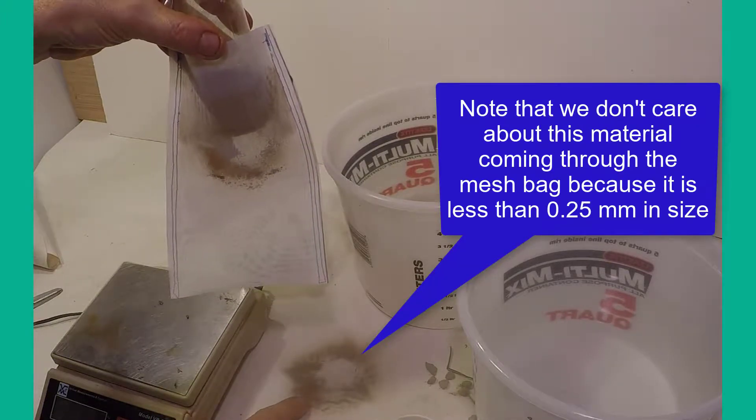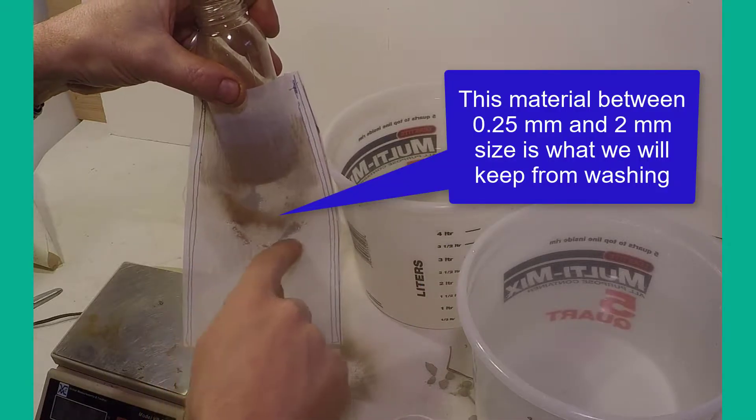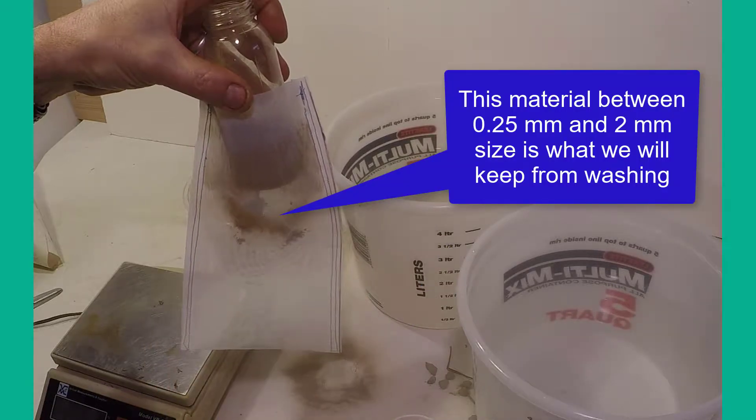Note that the material that falls through the sieve bag onto the table is not important to the measurement of soil particulate organic matter in this procedure.